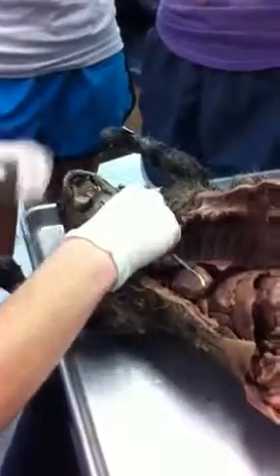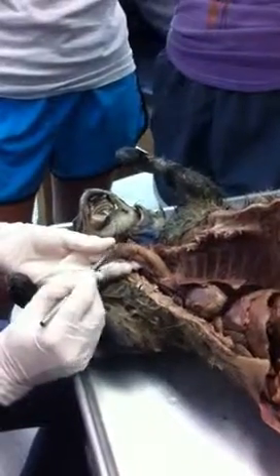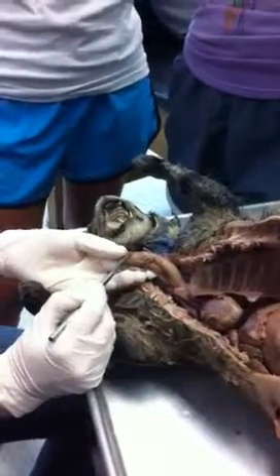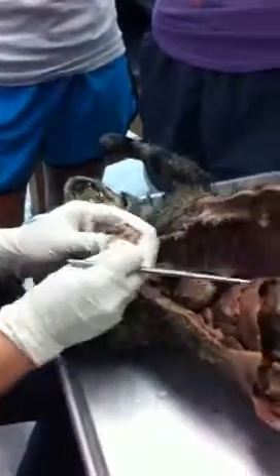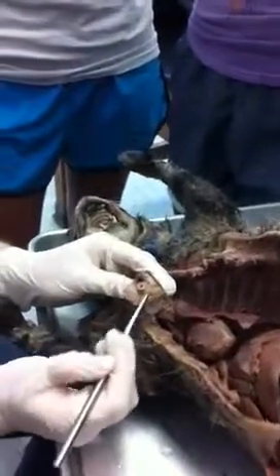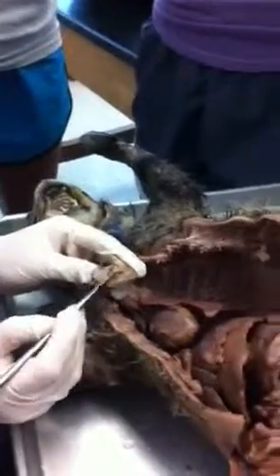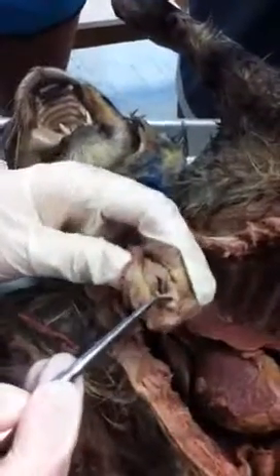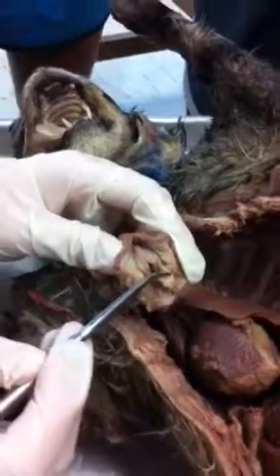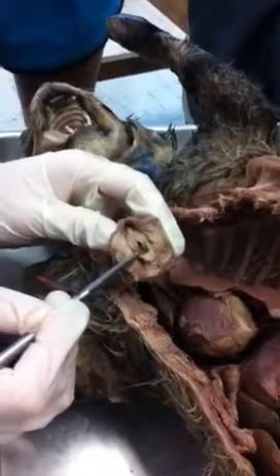Okay? So I'm going to pull this out, and you guys see this hard part right here I'm pointing to? That is your larynx. And I'm going to open it up. Everybody see this little rough spot right here? That's the back of the tongue. And then we come to this structure here. What is this? Epiglottis, which means epi means what? On top of. And then this is going to be the glottis.